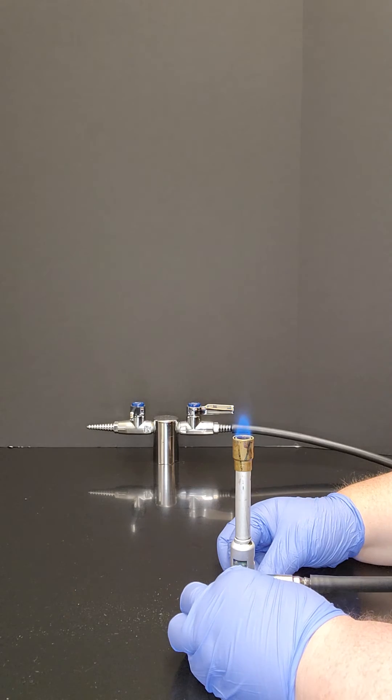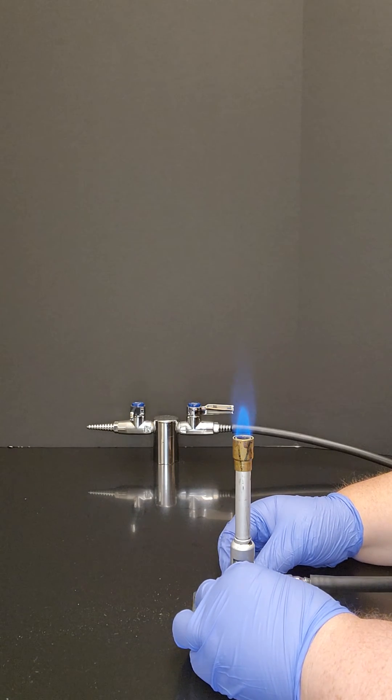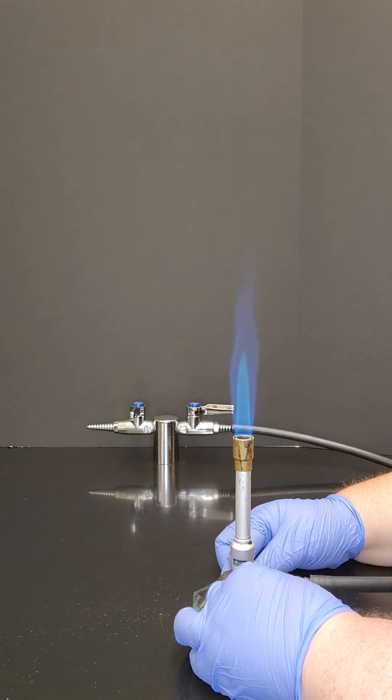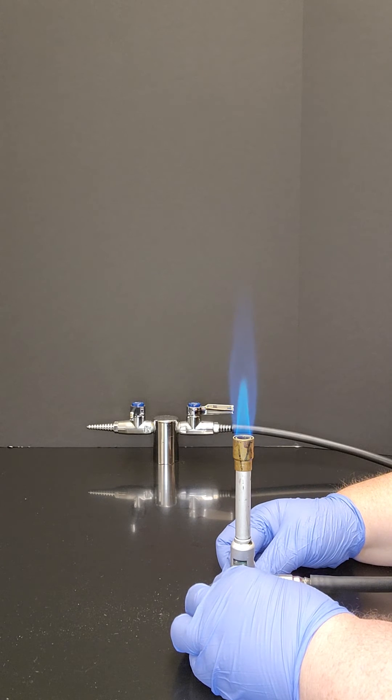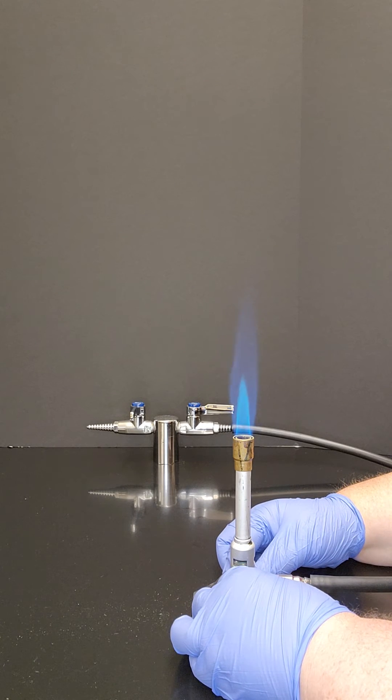If you turn it to the left the gas goes down. If you turn it to the right you get more. If you have too much fuel your flame is going to get sloppy.